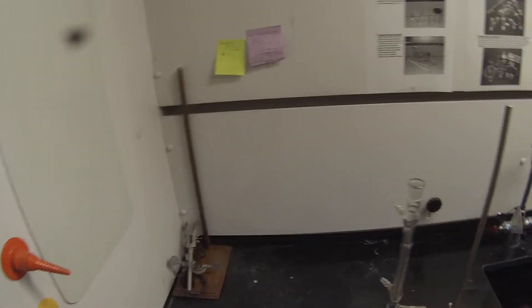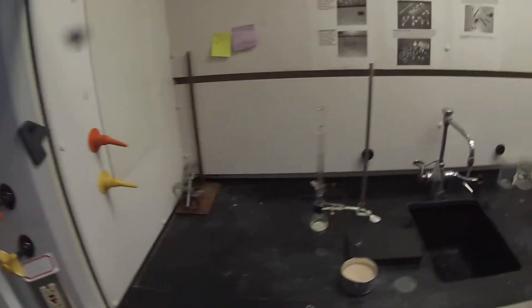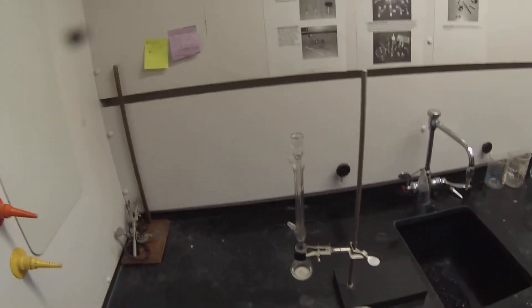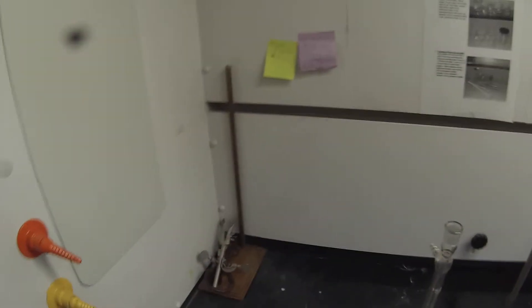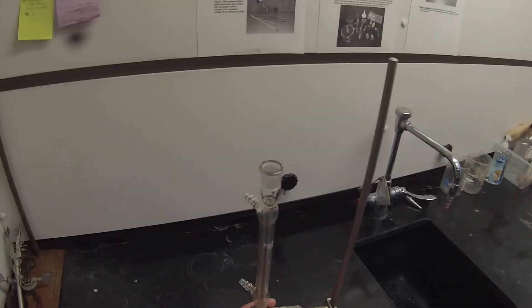For some reason my camera likes to shut down the first time I start it up, so we turned it back on. We're just going to put the stirring hot plate away and I'm going to move this back into the other hood.